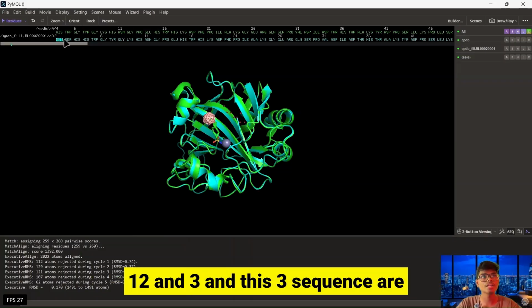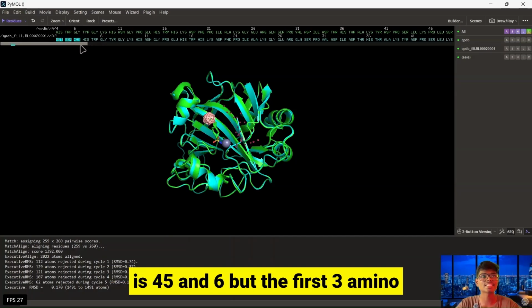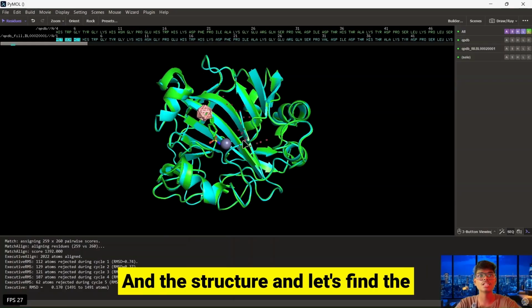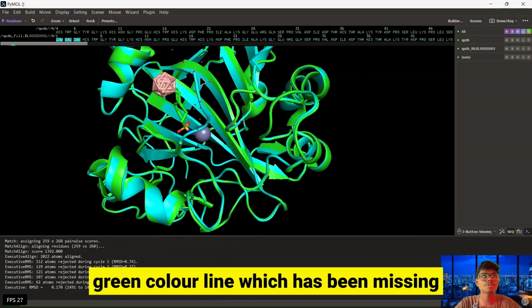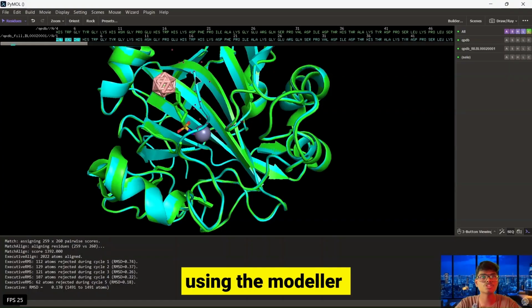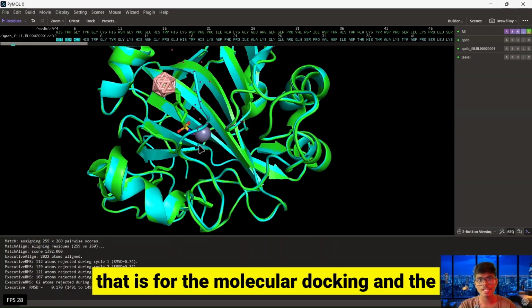So the sequence starts from 1, 2 and 3, and these 3 residues are absent in the raw PDB file, which starts from 4 to 6. As we know, HIS TRP GLY starts over here, that is 4, 5 and 6, but the first 3 amino acids are missing. Now let's zoom into the structure and find the difference. Okay, now I have zoomed into this structure, and you will find the green color line which has been missing. That is the raw protein structure, which stops here, but in the new protein structure created using the modeller application, this is the amino acid. Like this, the 3 amino acids have been redesigned, and now it is ready for the next step, that is molecular docking and molecular dynamics.